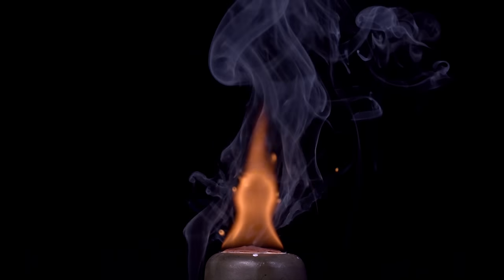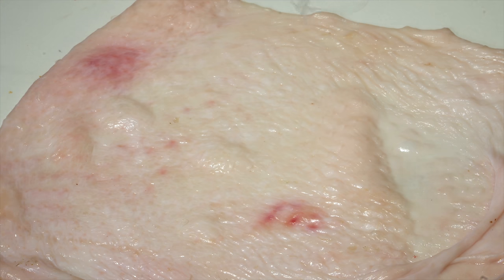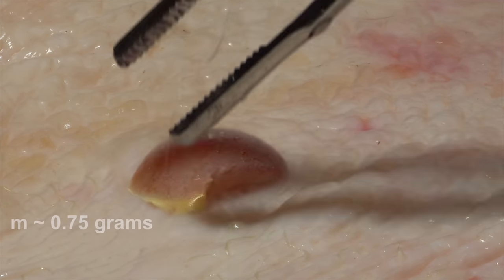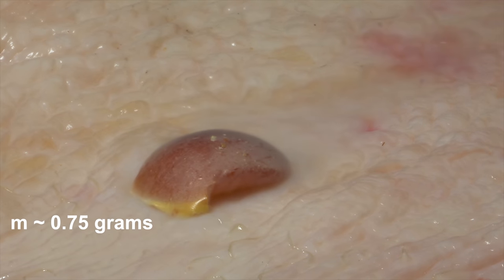Don't take white phosphorus with your bare hands, as the skin temperature is higher than that of the environment and white phosphorus ignites much faster when it contacts with skin, compared to the ignition in air.